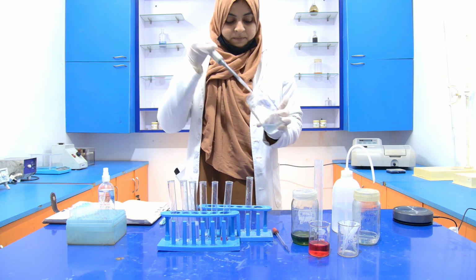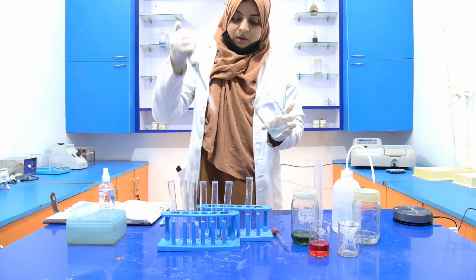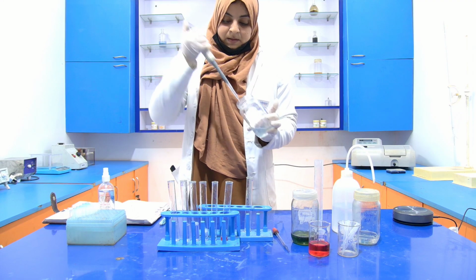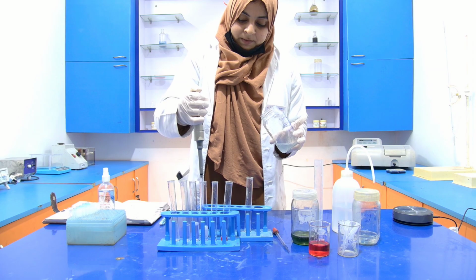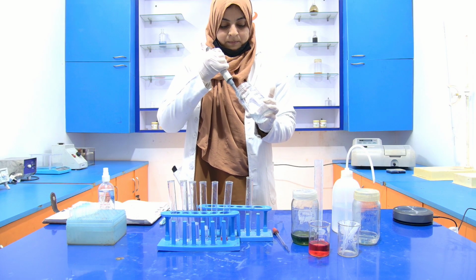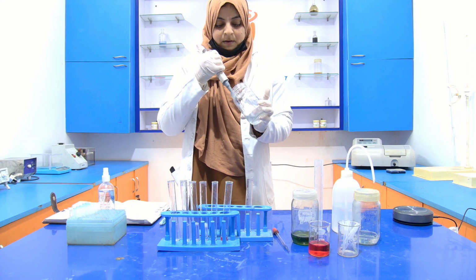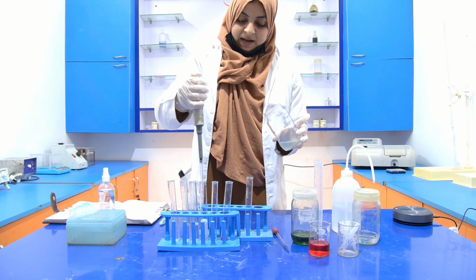Then the fourth test tube: 1, 3, 4, and 5.